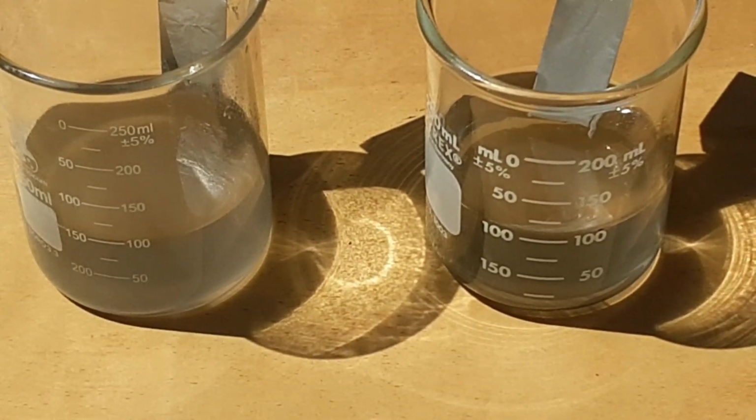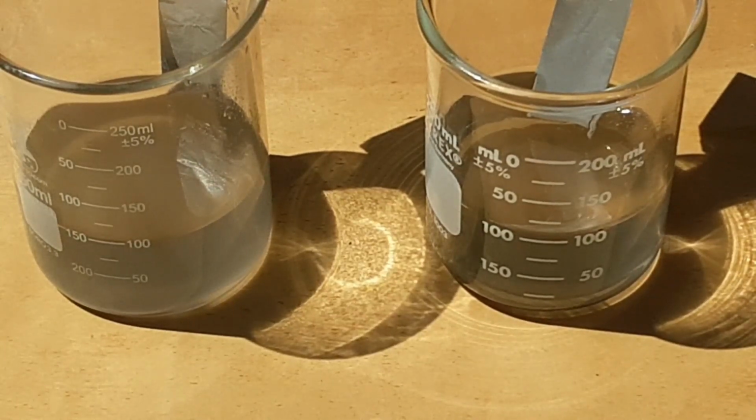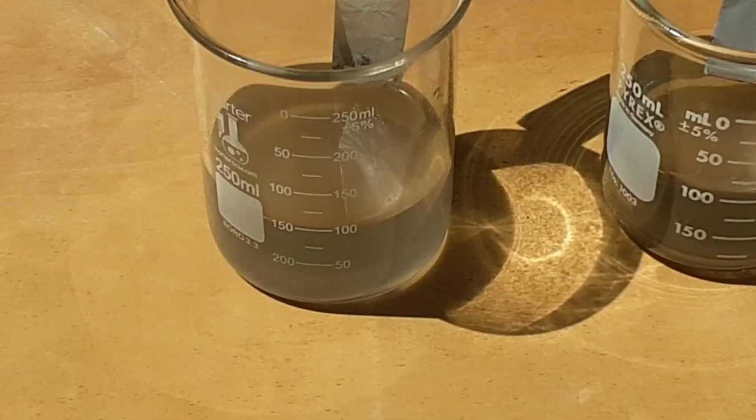Not quite sure what to make of this. I don't know if I miscalculated something. I'll have to go back and triple check my math here to make sure I didn't do something stupid. So on a humorous note, my chemistry experiments are pretty much consistent here. I seem to get results that defy what my initial expectations were. And at the end of the video, I'm only left with, what the hell just really happened here? Not sure. Potassium hydroxide definitely beat the sodium hydroxide.